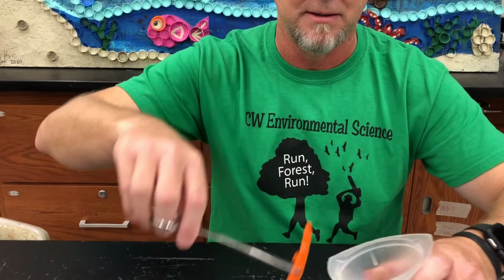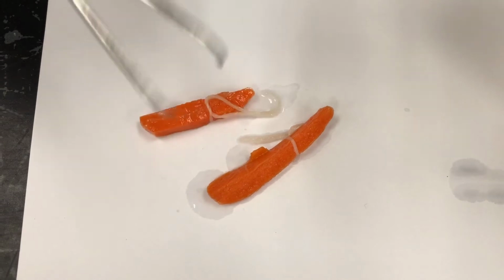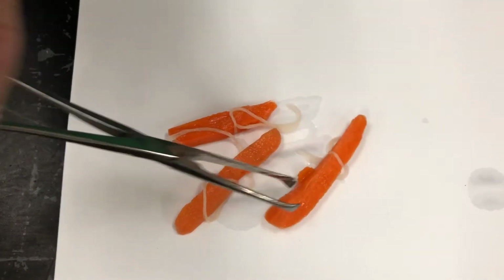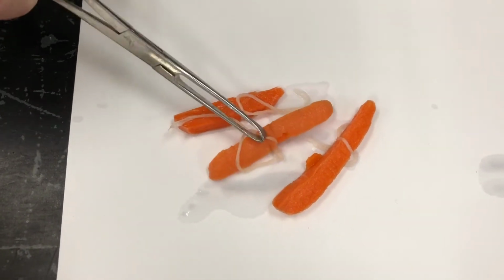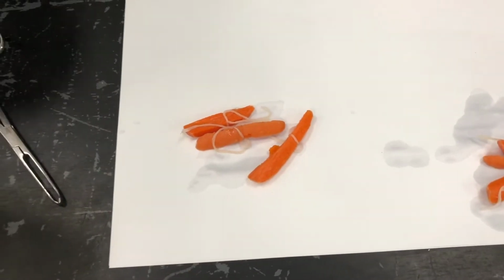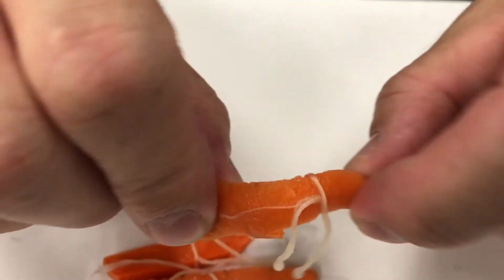So now I'm gonna take the carrots out of the salt water and let's look at what happened to them. Okay, there's one. There's two. And the third. Well, if I ask the same set of questions that I did the last batch of carrots, is the thread tight or loose? Look at that. This thread is coming off. It's so loose I can get the forceps underneath it. Okay? And as far as texture is concerned, these guys are way more bendy than the other ones.